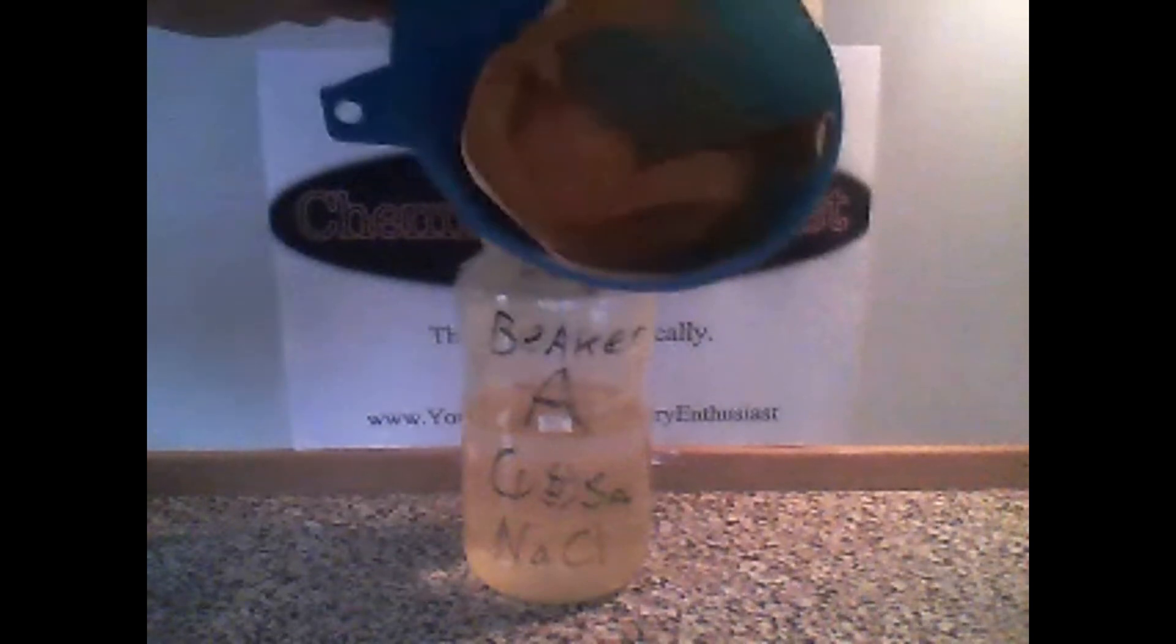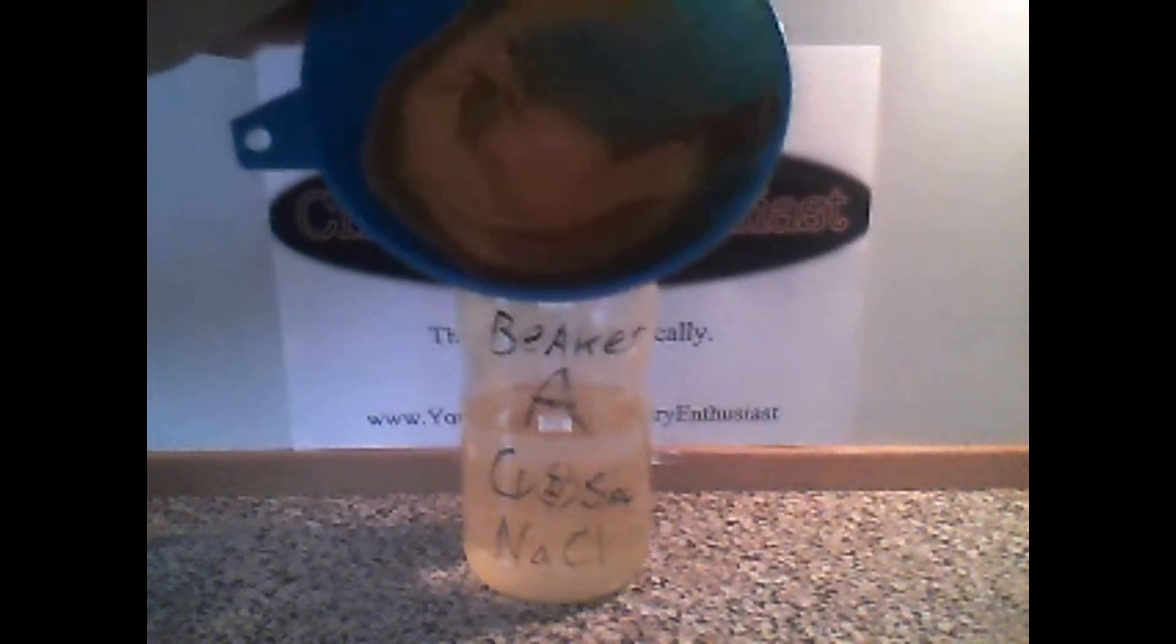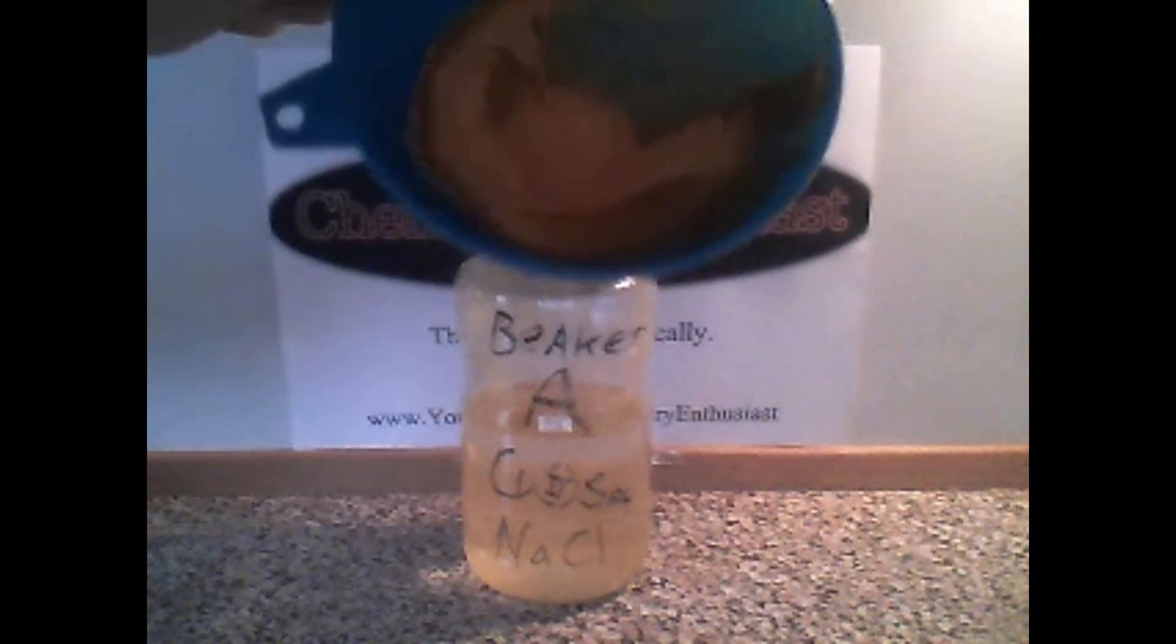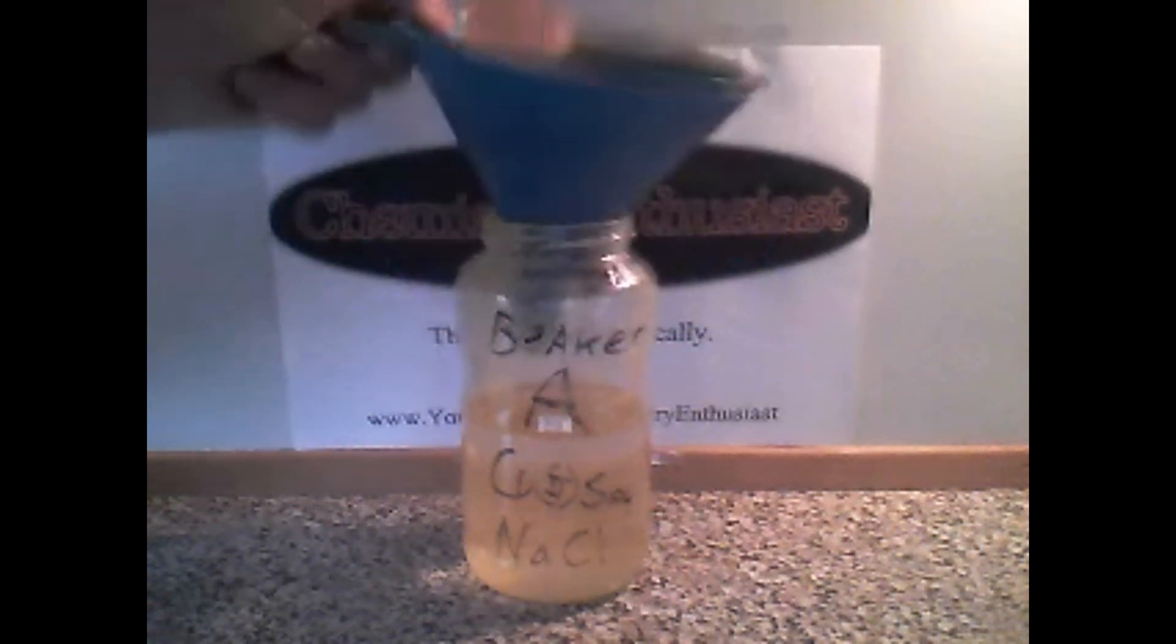Okay, now all the liquid has filtered through, and you are going to scrape out the chemical and discard the liquid. I have collected the chemical in the beaker.